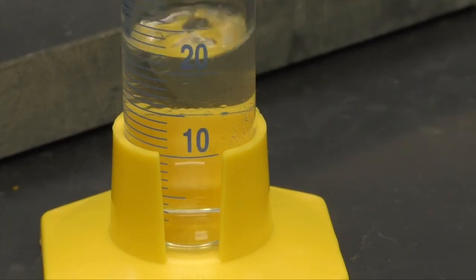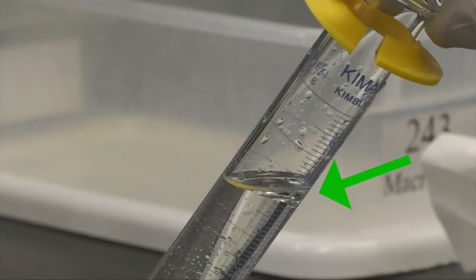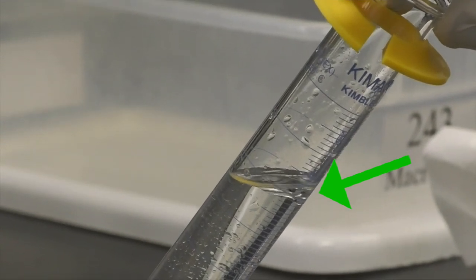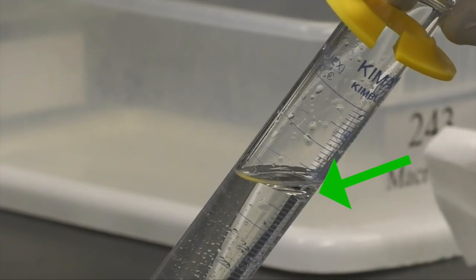If you look carefully, you can see the oil droplets in the sodium chloride solution. You'll want to collect condensate until you have approximately 1 to 3 milliliters of oil, which you'll see on top of the aqueous solution. Tilting the graduated cylinder helps you to see the oil.